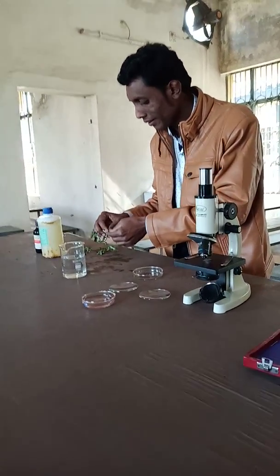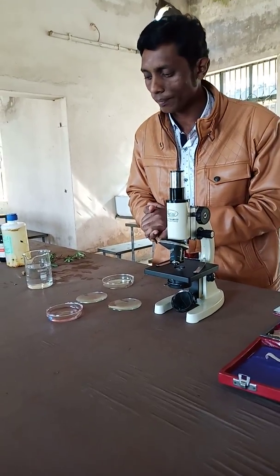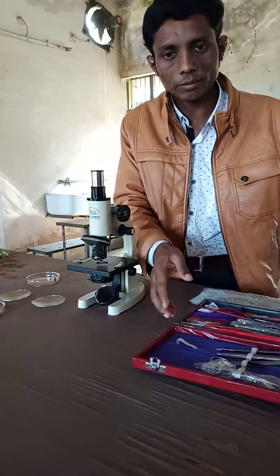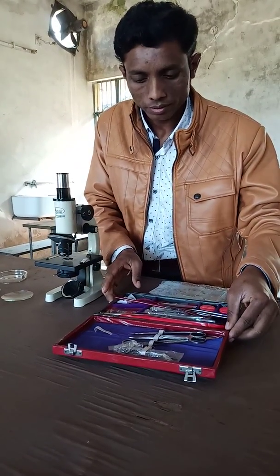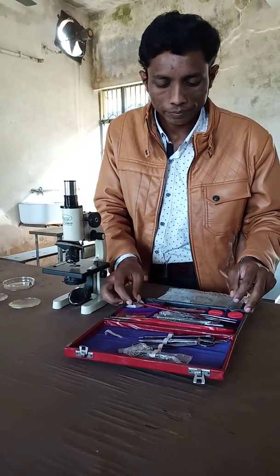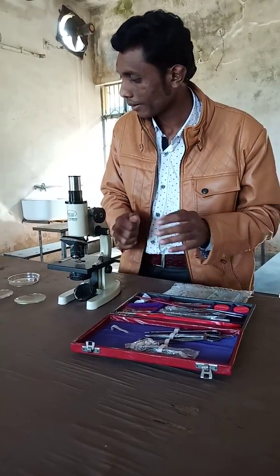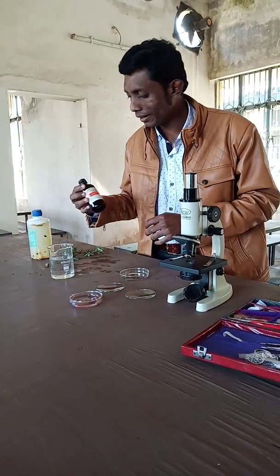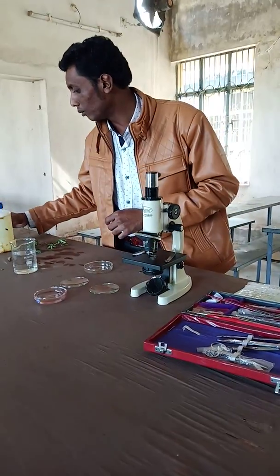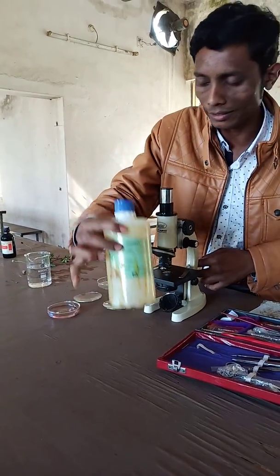For that we need the dissection box, from where we use brush, needles, and other tools. For the chemicals, to stain it we have safranin stain, and for mounting the specimen on the slide we should use glycerin.